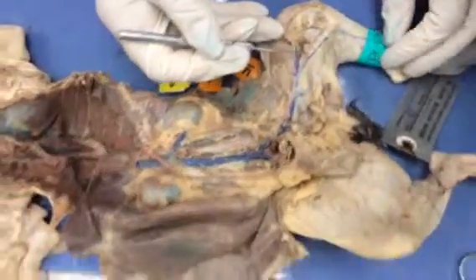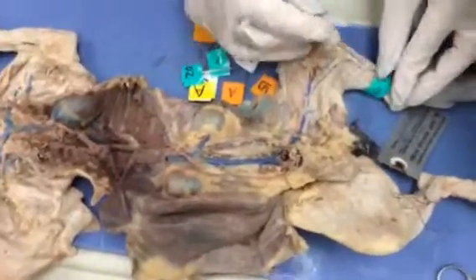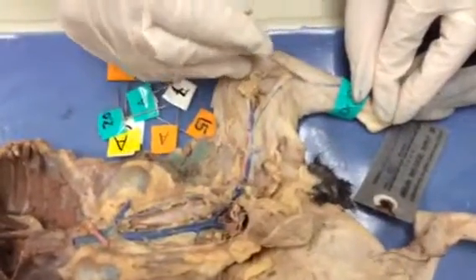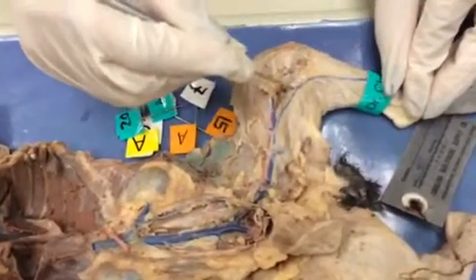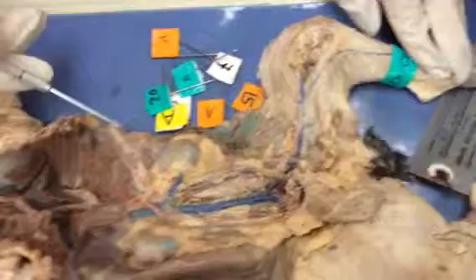Furthermore, that femoral goes into the inner thigh and is called the saphenous vein. You see how it goes all the way in the inner thigh. Saphenous vein, the great saphenous vein. So let's do a review again from the top.